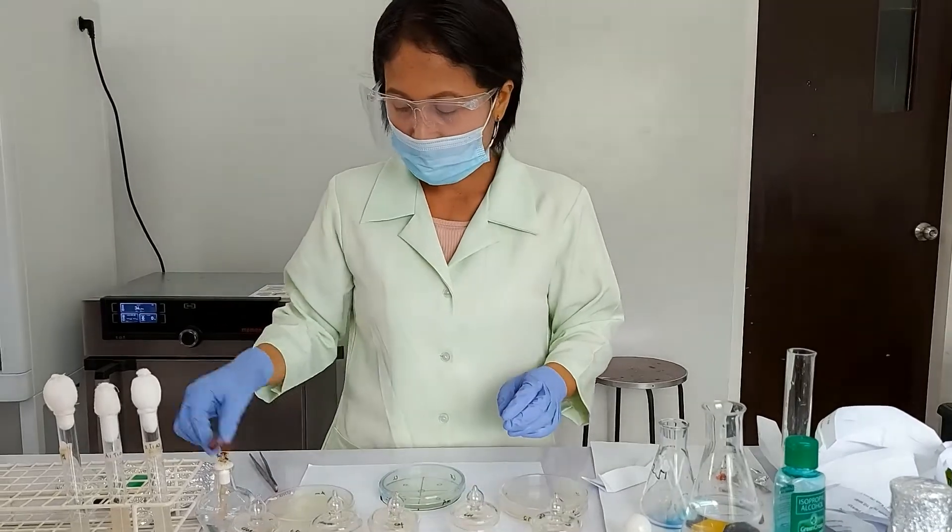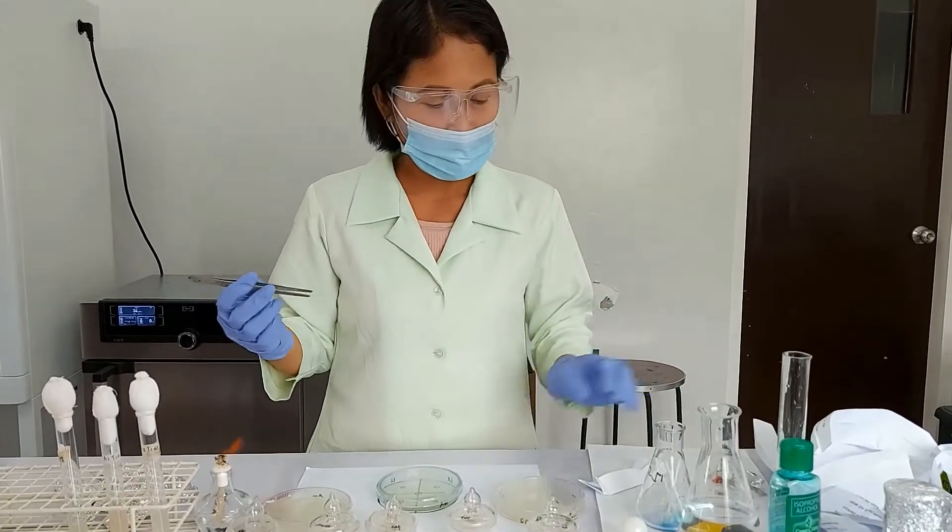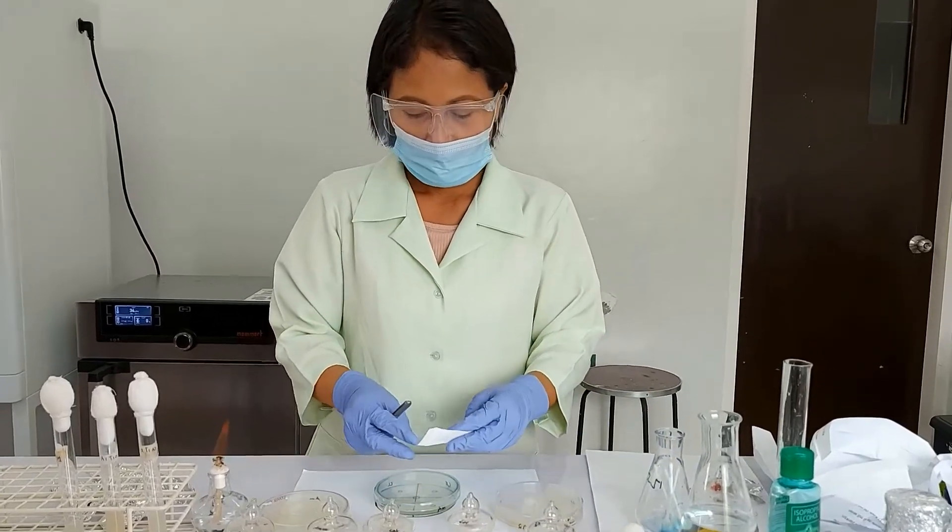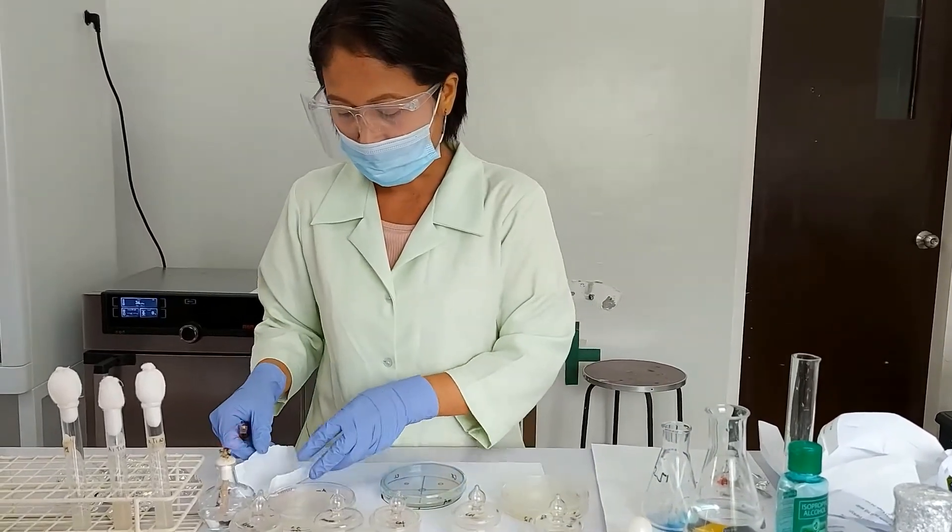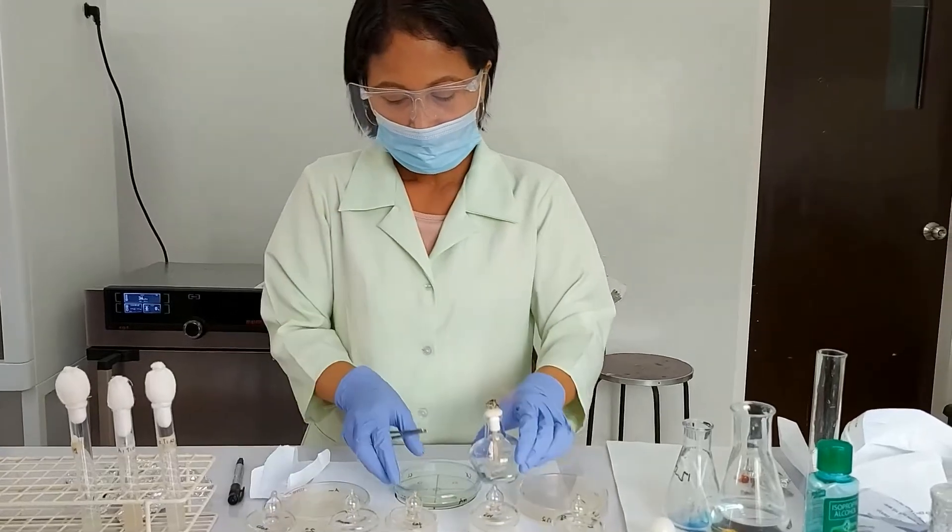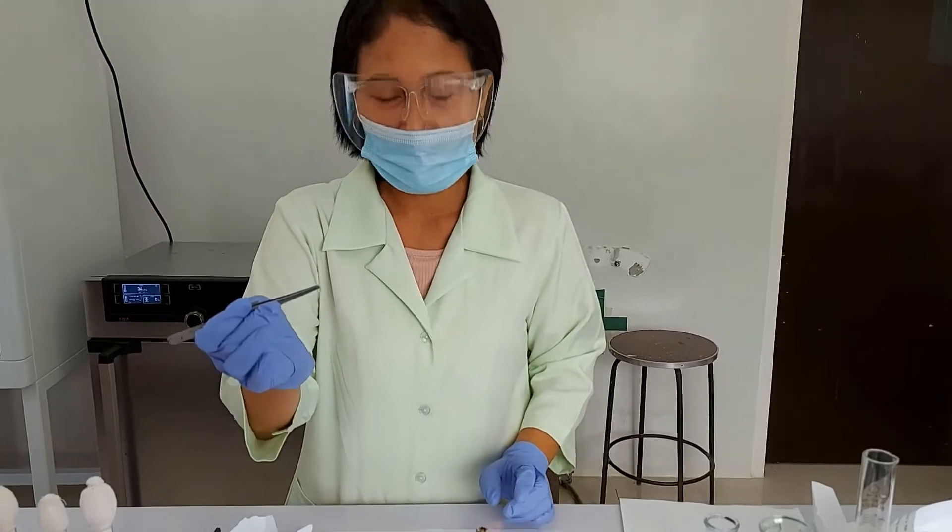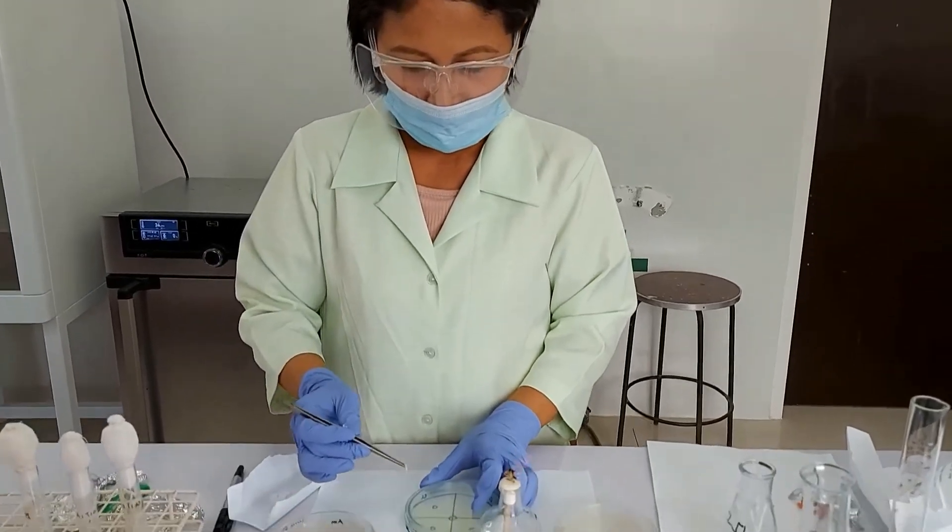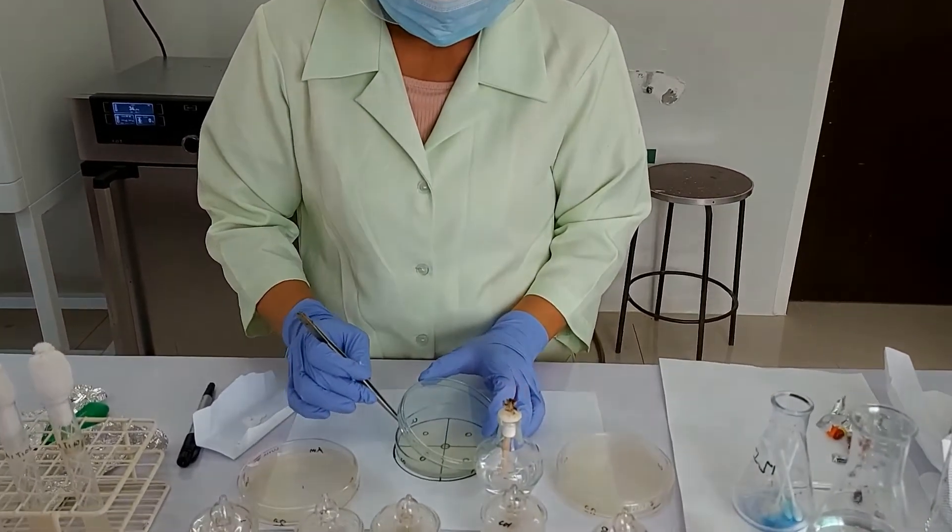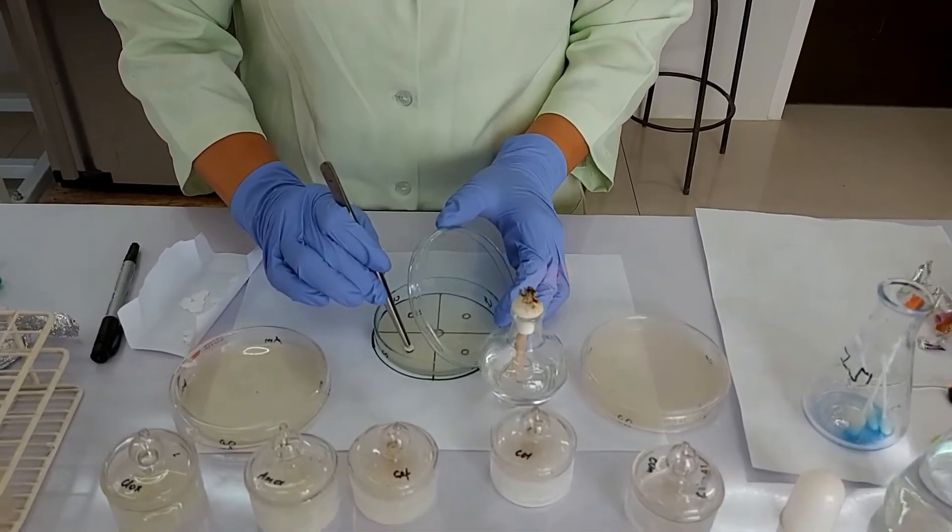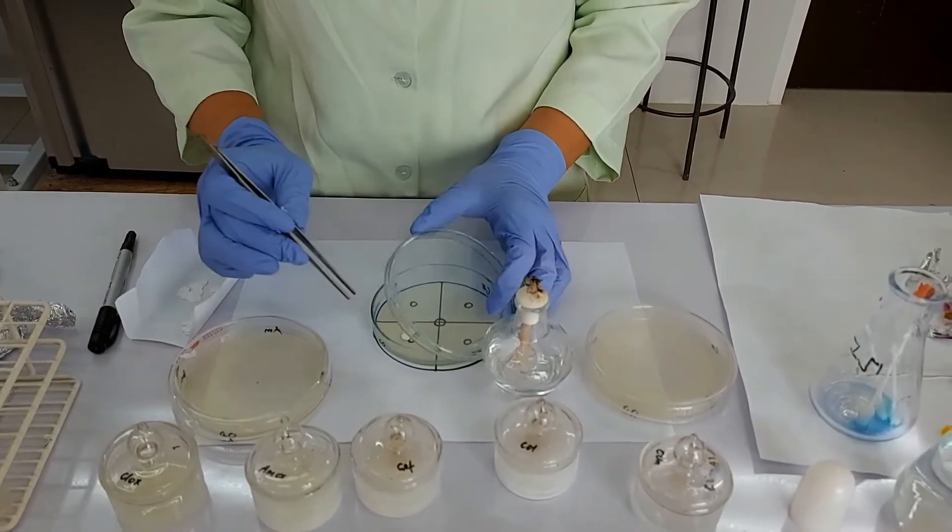We put our filter paper without treatments yet, aseptically. We are going to place this and press it a little so that it will be flat on the surface.